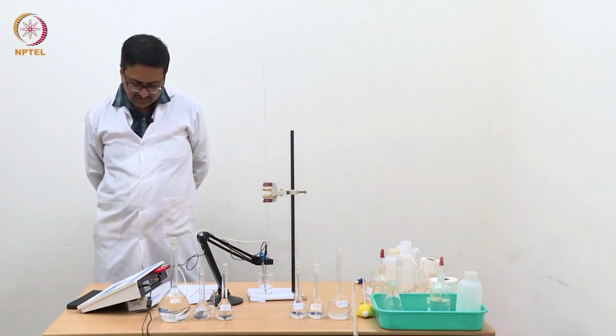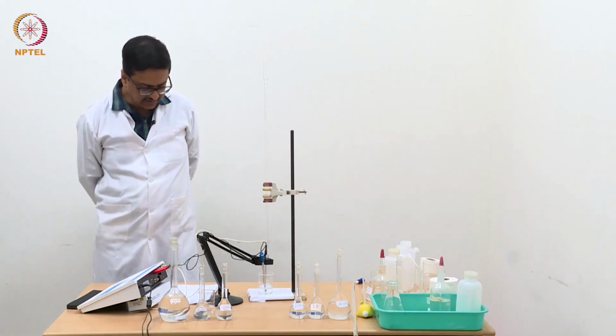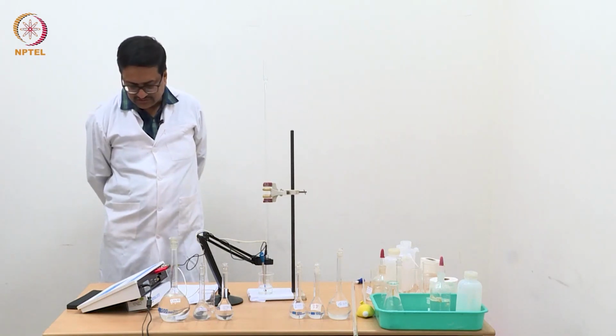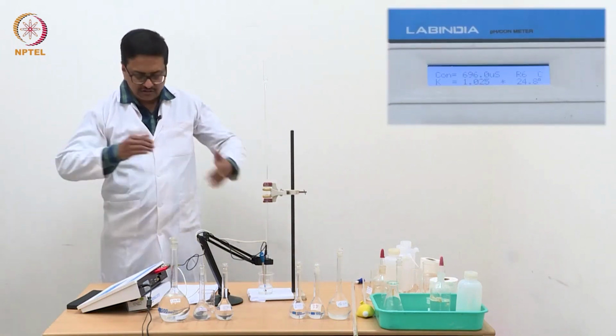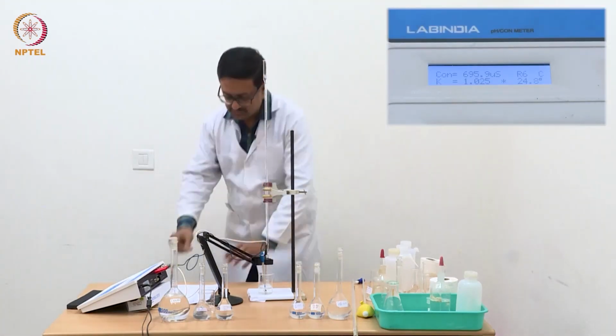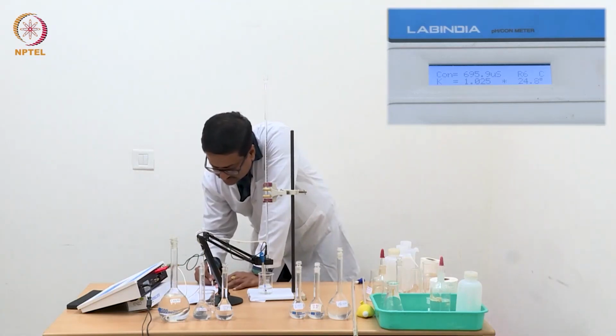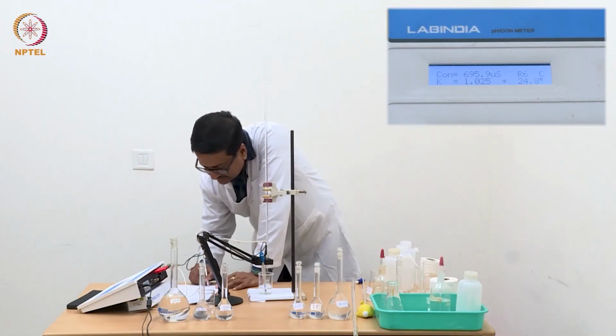So now we see that we are reaching little more than 688, 695, 697, which is about 40 to 50 microsiemens increase from the previous value.